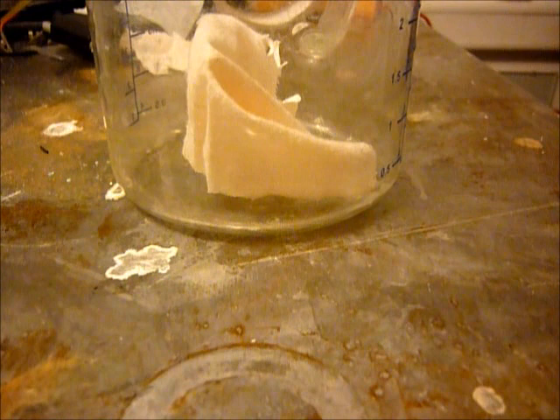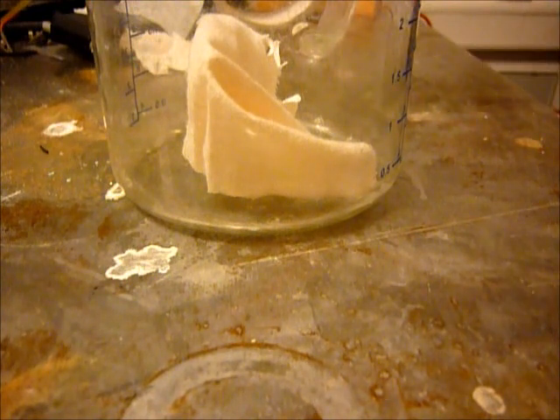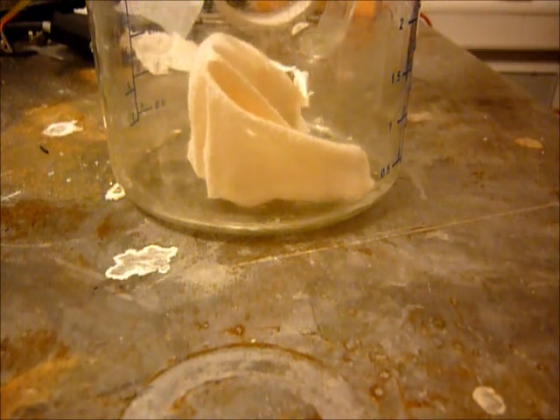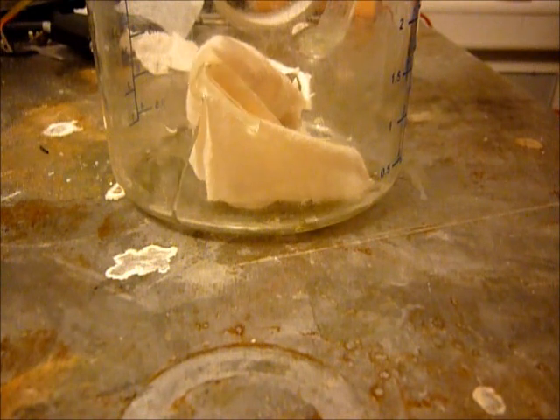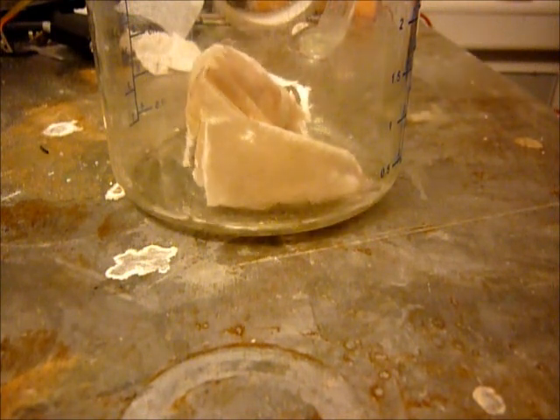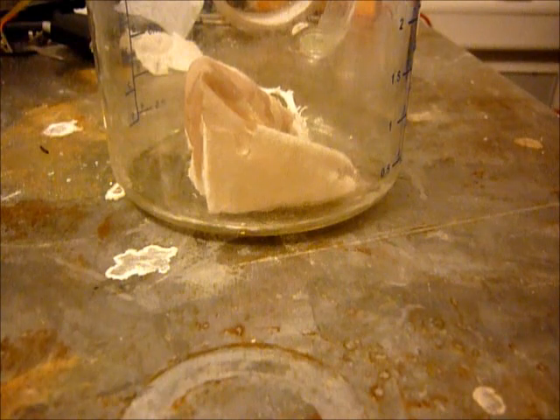So now here I have my sulfuric acid and here is a piece of cotton. Let's show what happens. Now it's covered with sulfuric acid.